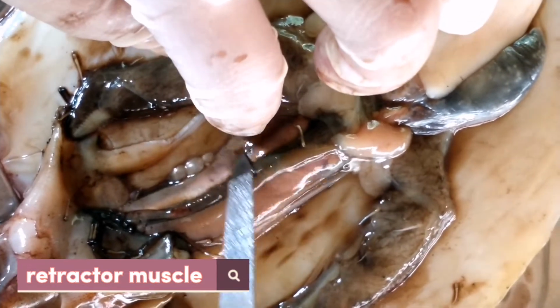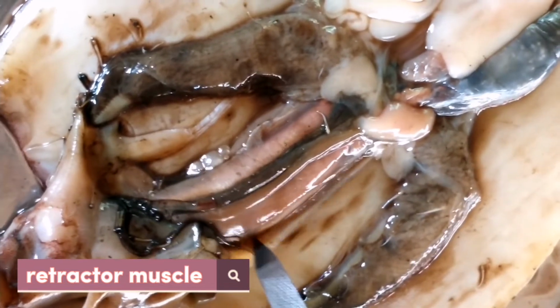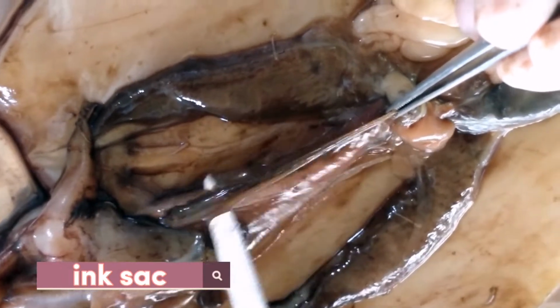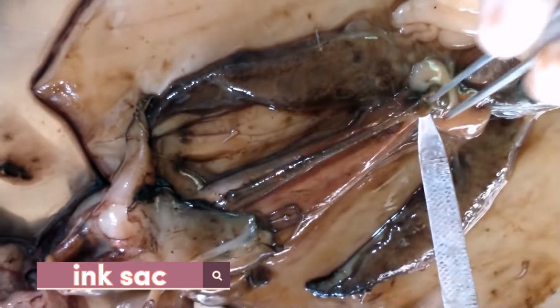And this structure is what they call retractor muscles. There are also one on each side. These retractor muscles move the squid head, and the squid uses these muscles to steer. And this dark structure right here is called the ink sac of the squid. Squids eject ink from their ink sac to distract predators while they escape.